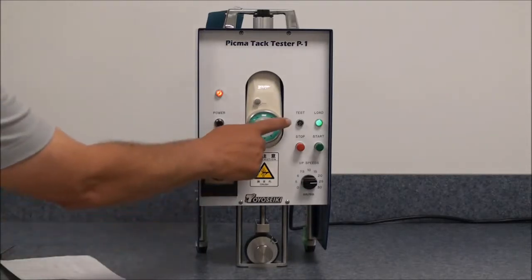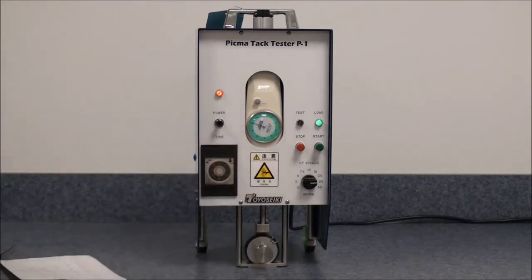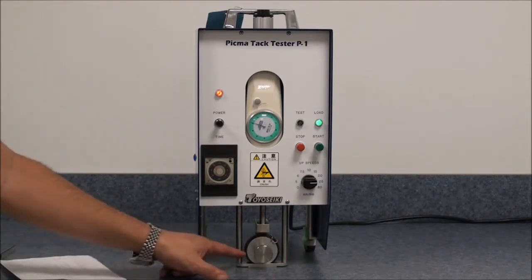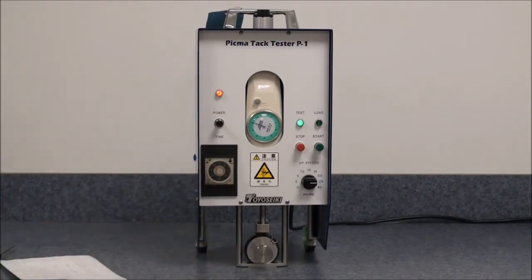When it makes contact, the test light will come on, and the dwell will be on for the predetermined amount of time.